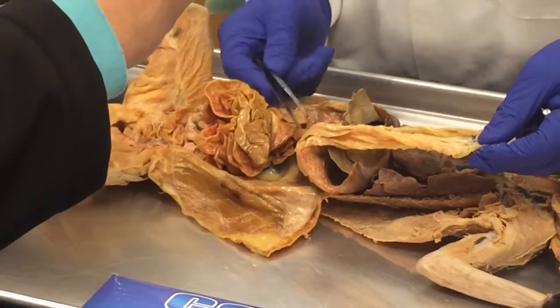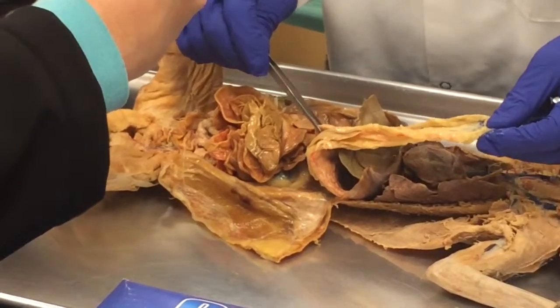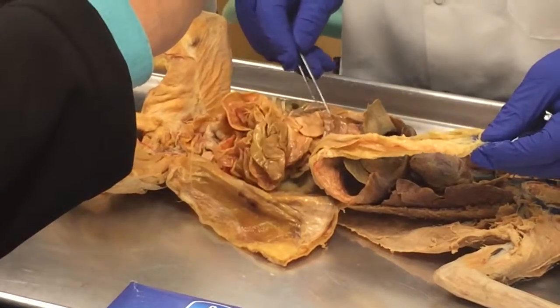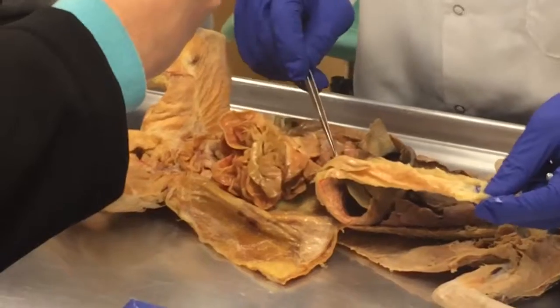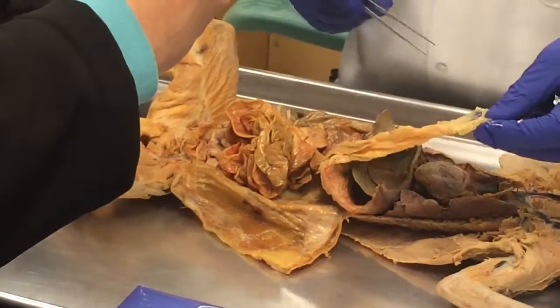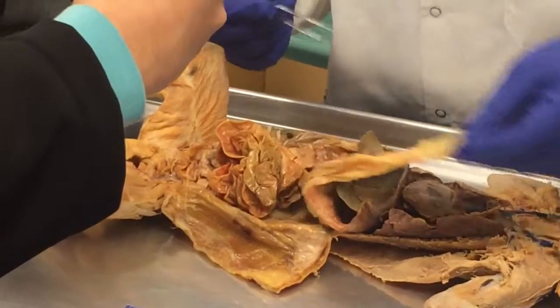I've always been saying that sometimes I'll put the pin for the pancreas here, or sometimes if I want, I'll put it right there. You know what I'm saying? All this is pancreas. Hence the pancreas. And there's the spleen. So that's a good thing.